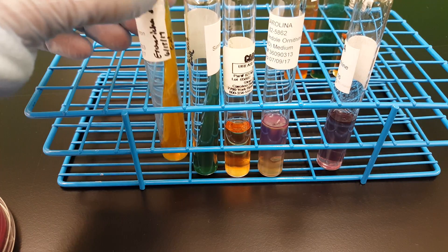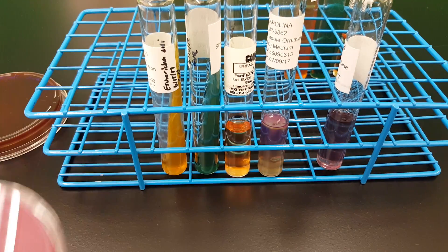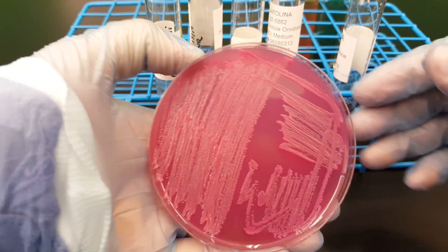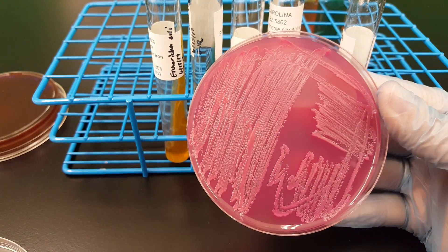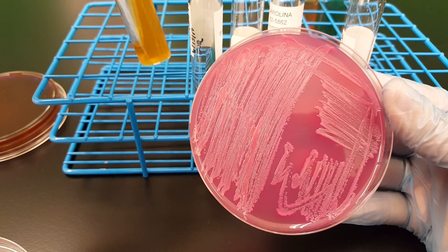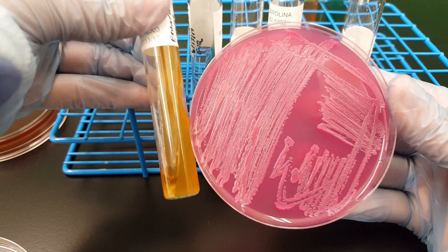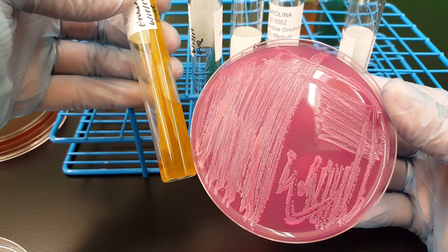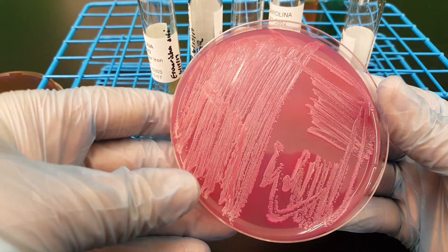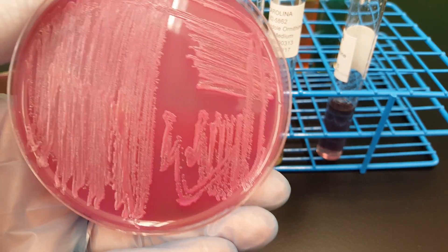A good way to check if your TSI slant results make sense is to look at the organism on a MacConkey agar plate. The MacConkey plate differentiates between lactose fermenters and non-lactose fermenters among the gram-negative rods we're testing — the Enterobacteriaceae group. This matches: we have A over A in the TSI, which means it ferments lactose at the slant, and it appeared pink on the MacConkey agar, also indicating lactose fermentation. That's a good check you should perform anytime you do this testing to make sure your results make sense.